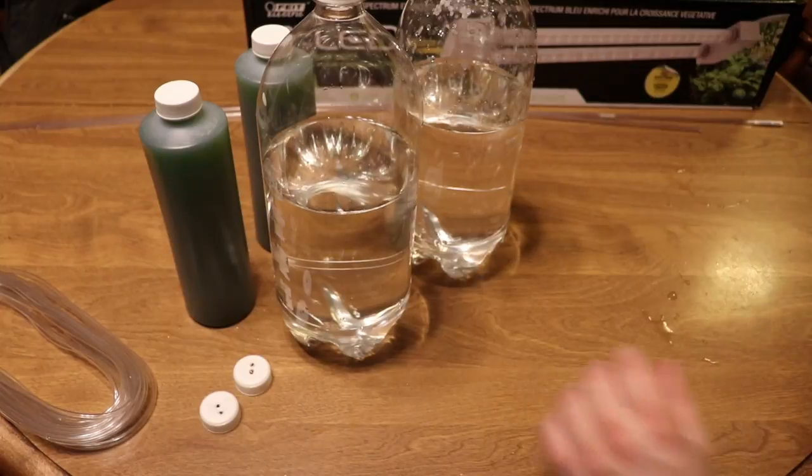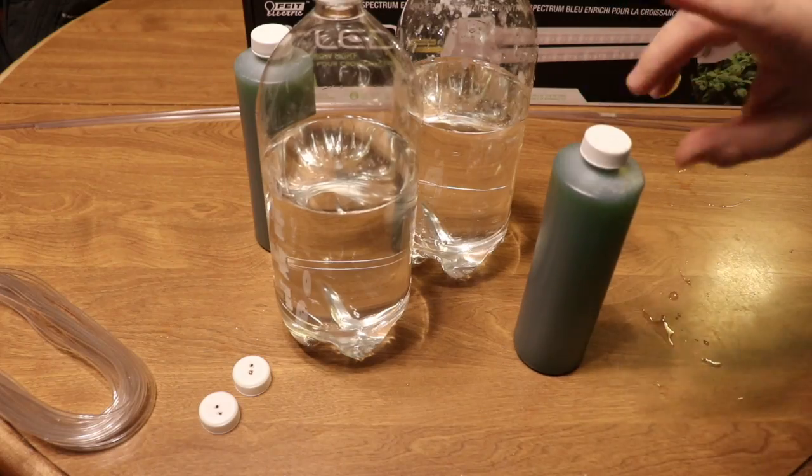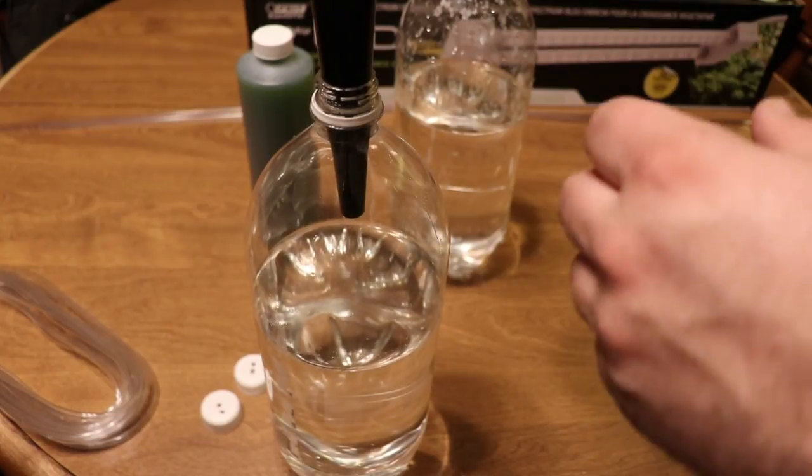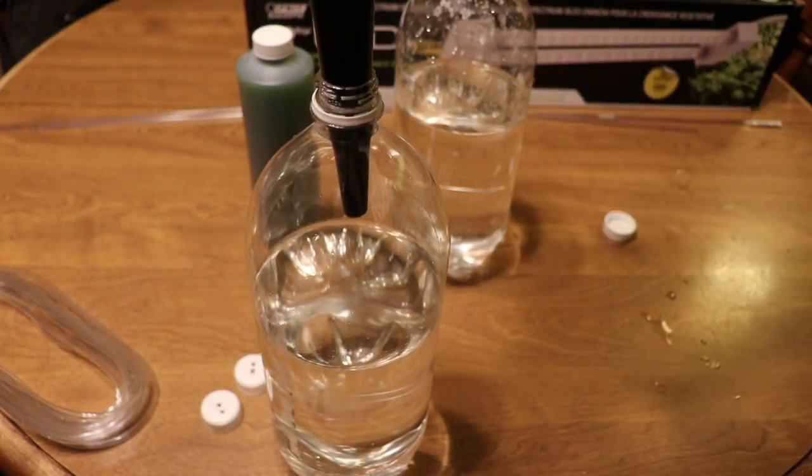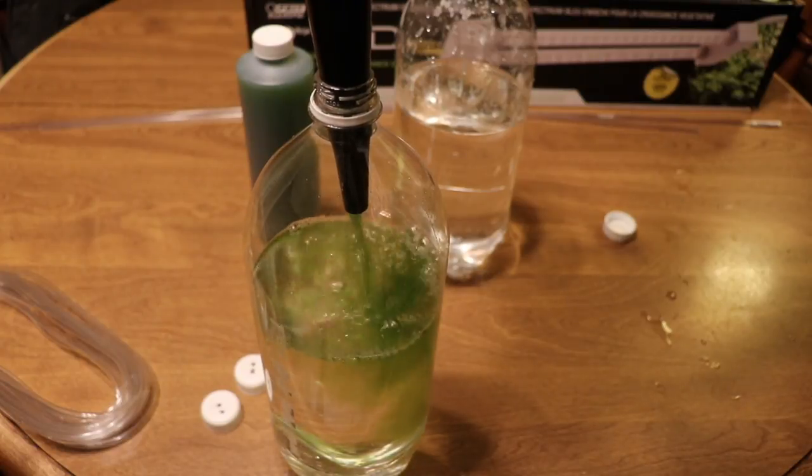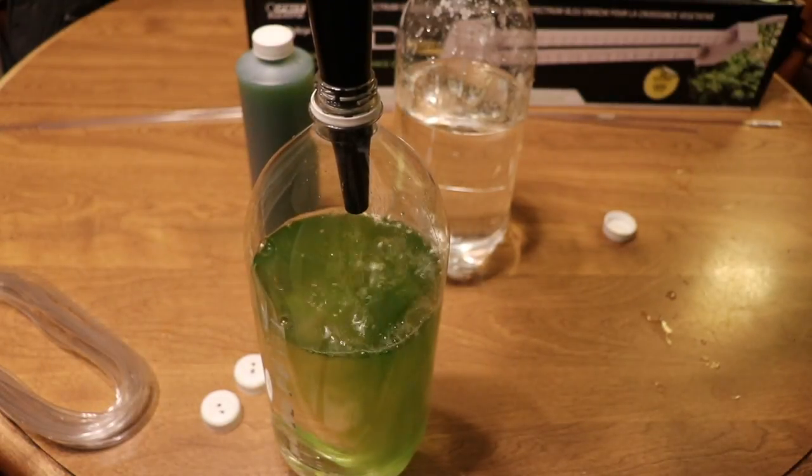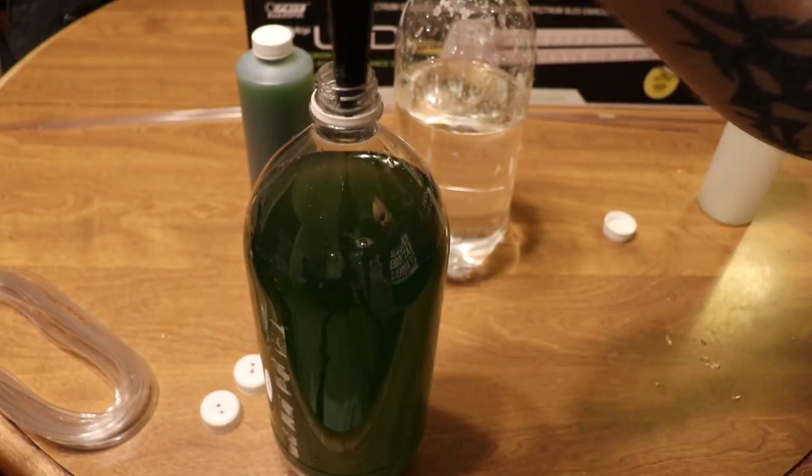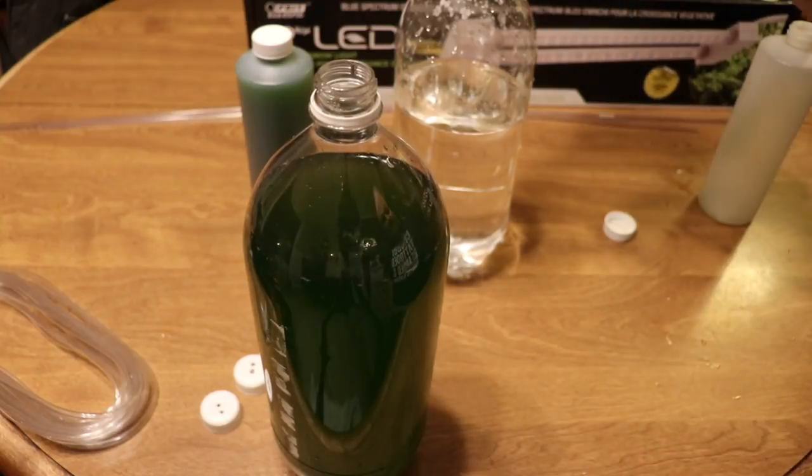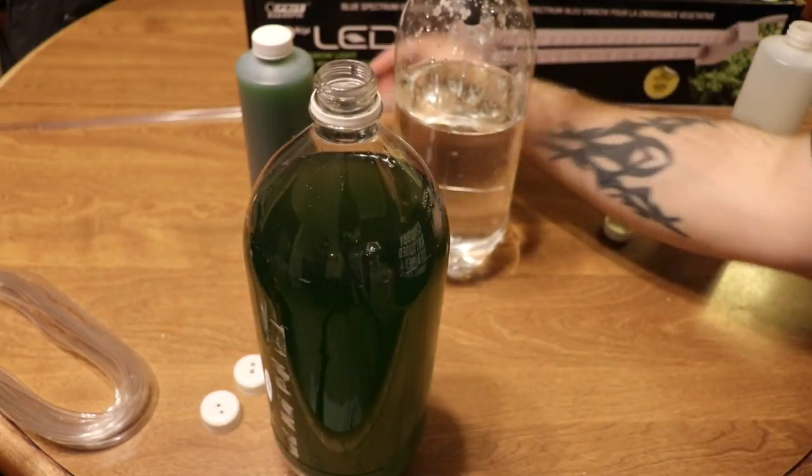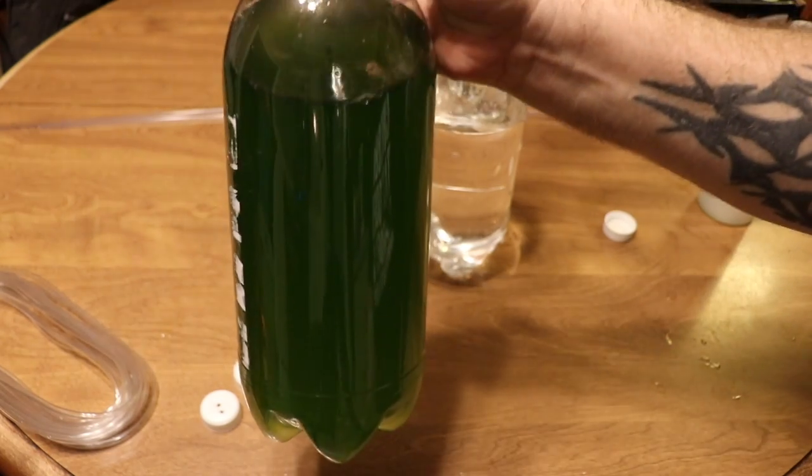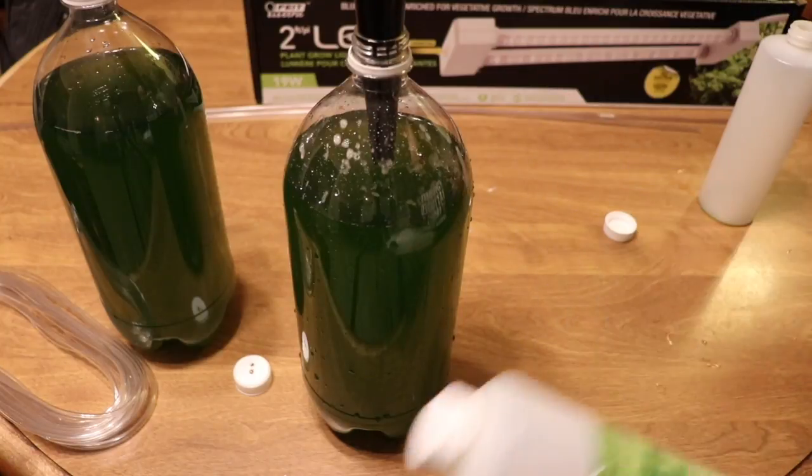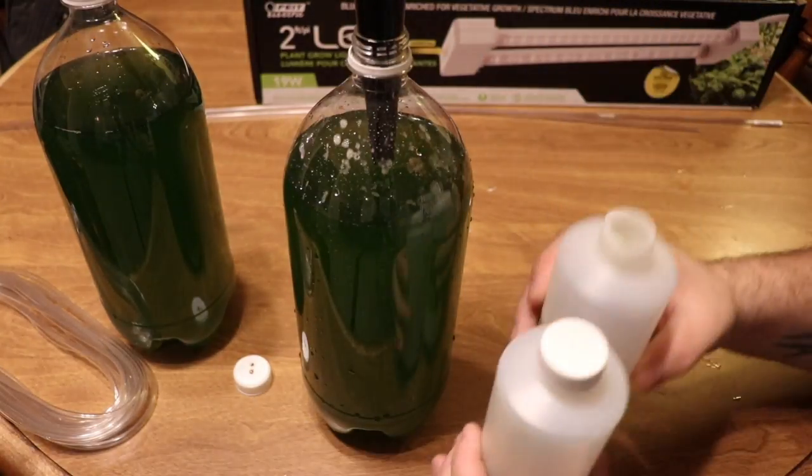Basically one milliliter to two liters. Alright, so I got my funnel. Now we're going to pour the phytoplankton in. I'm actually pretty happy with that. Plenty—that is plenty.